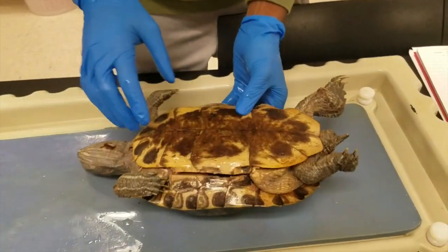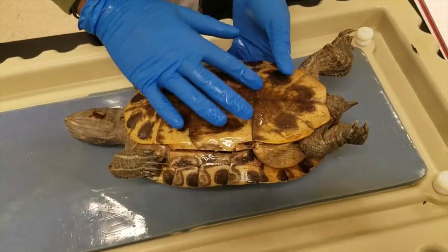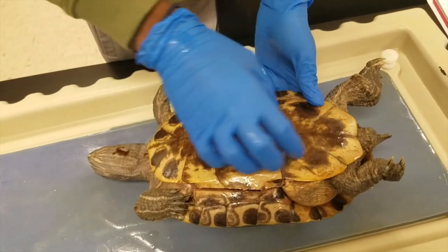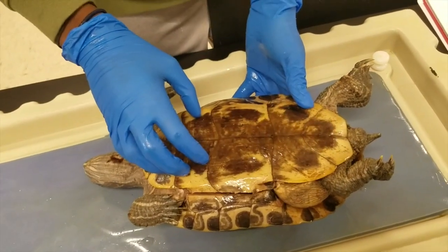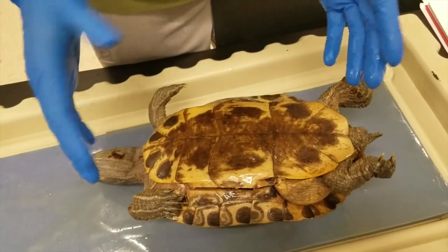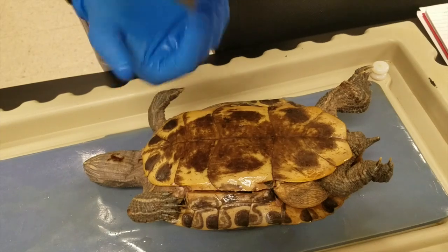The plastron has this shading right here. This is to break up the silhouette of the turtle so that it's not easy to spot whenever it's swimming from the underside.